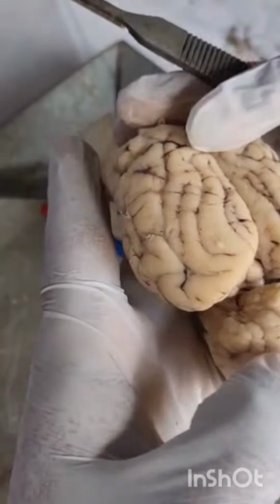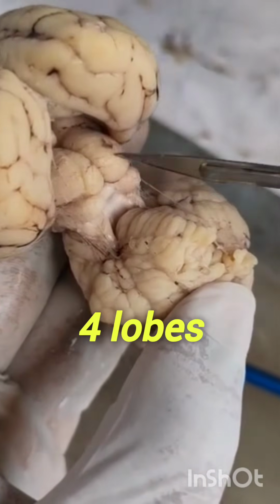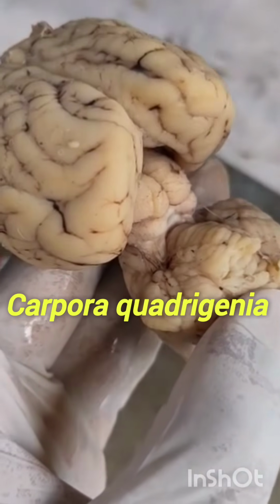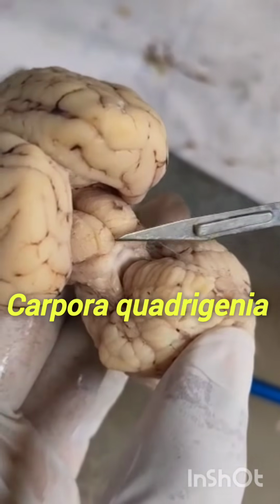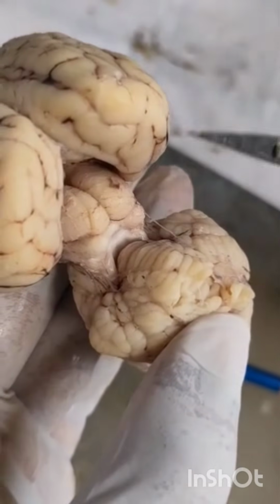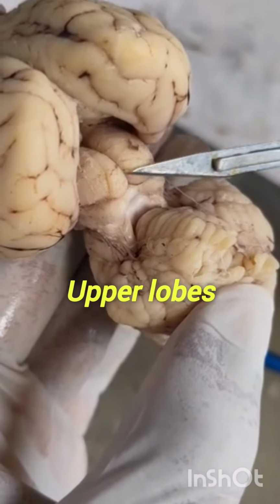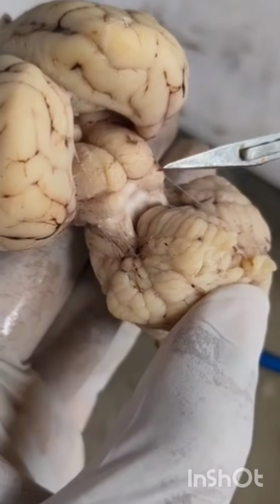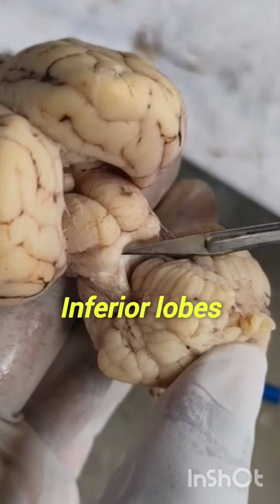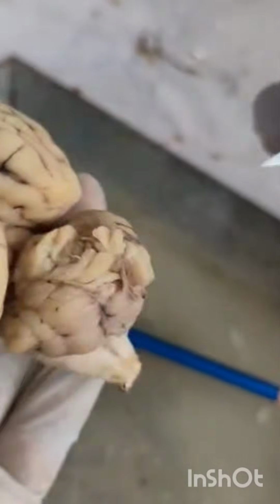Forebrain, and come to this, the midbrain. See, you observe here 1, 2, 3, 4 lobes are there. These 4 lobes are together called corpora quadrigemina. The 2 upper lobes, the superior lobes, are meant for vision. And the 2 lower lobes are called inferior lobes. These 2 inferior lobes are meant for auditory purpose. So 2 superior lobes and 2 inferior lobes; these 4 lobes are called corpora quadrigemina.